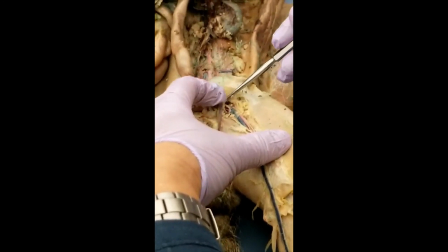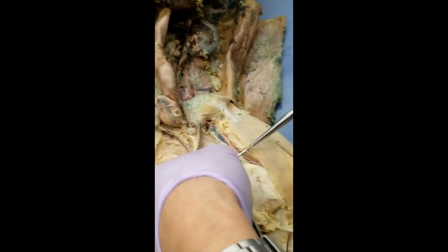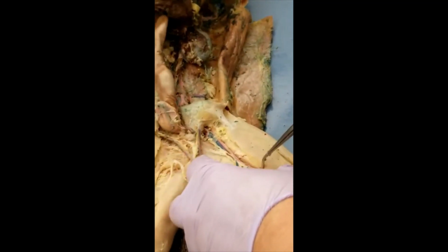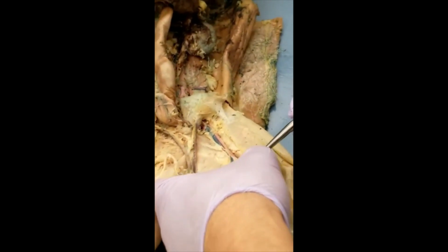Outside over here, you have femoral, veins and arteries side by side. Internal, deep femoral, veins and arteries side by side. You get saphenous, artery and vein side by side. You get popliteal. We were looking at it when we flipped it. Yeah, you can see where it comes from.